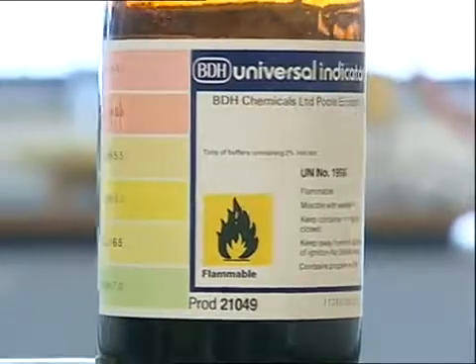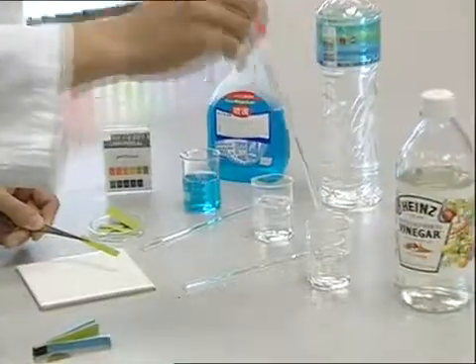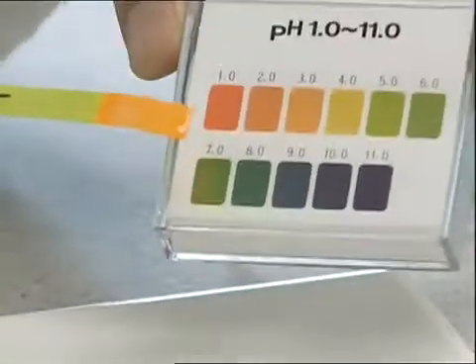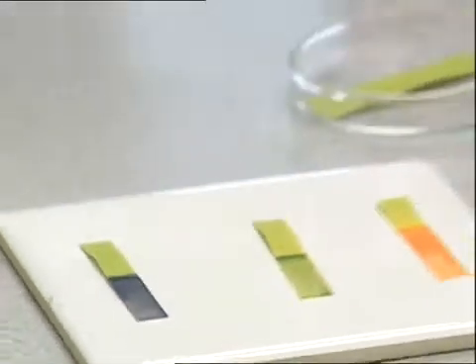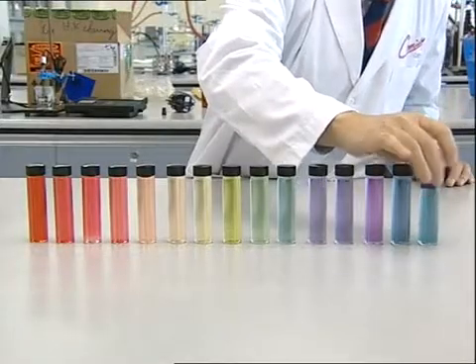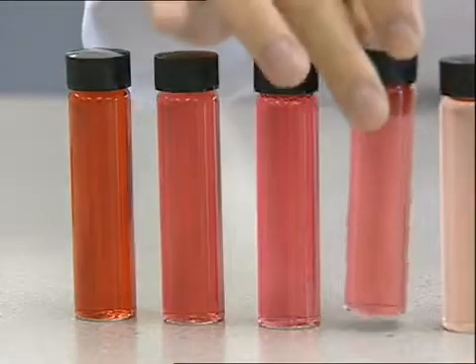Normally, the universal indicator is used with reference to a color chart. This enables us to check the pH value of a substance by comparing the color of the mixture to the chart. Therefore, if we want to determine the pH value of a substance, we can mix it with the universal indicator or soak pH paper made from it. Then, by checking it against the color chart, we know its degree of acidity or alkalinity. For solutions with extreme pH values, the colors shown by the universal indicator are less clear.